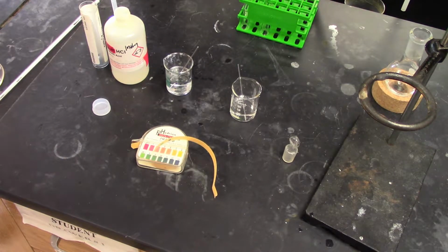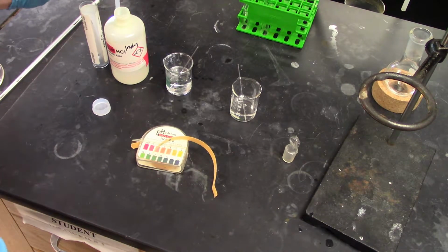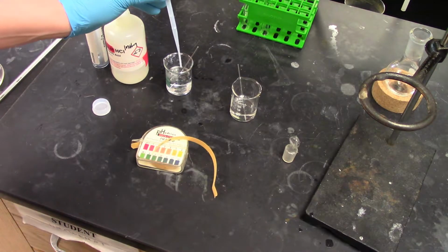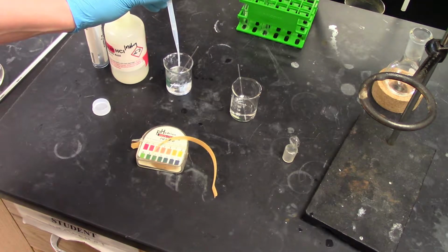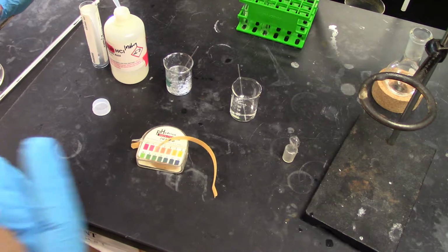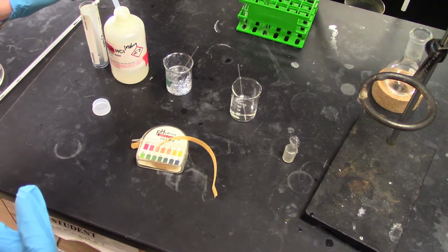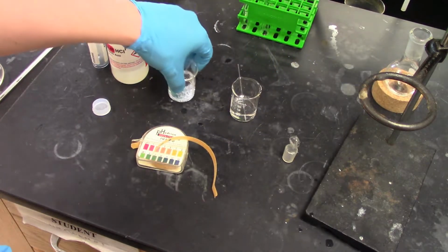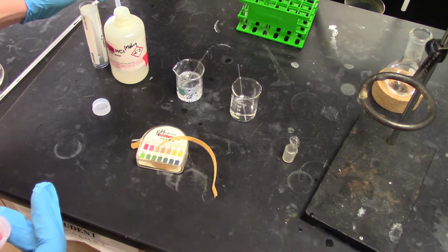Let's see what it says. Maximum about 3 to 4. Honestly, it's okay if you go over. So if I take solution A and I add an ml of acid, what I see is that there's this kind of foggy precipitate that forms, but then it immediately disappears. What you're seeing right now is the reaction of bicarbonate with the acid, so I need to add more.